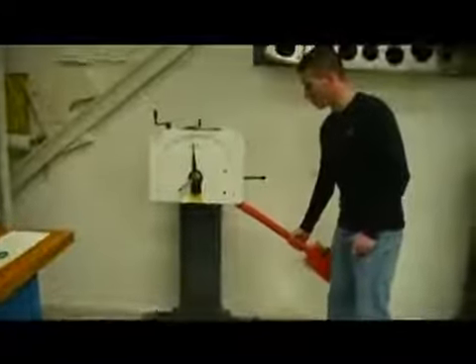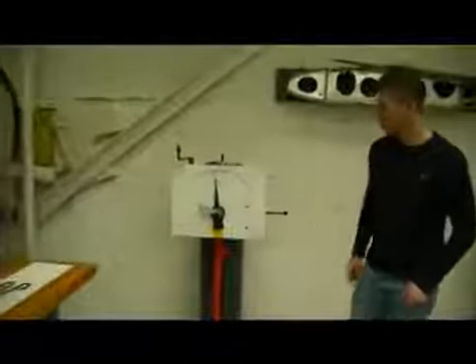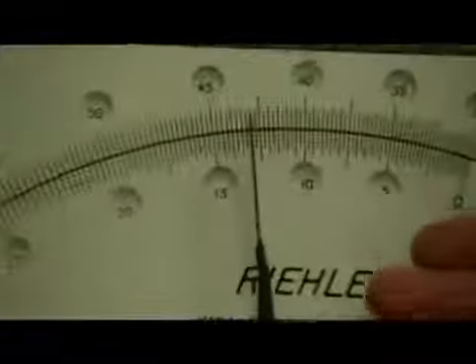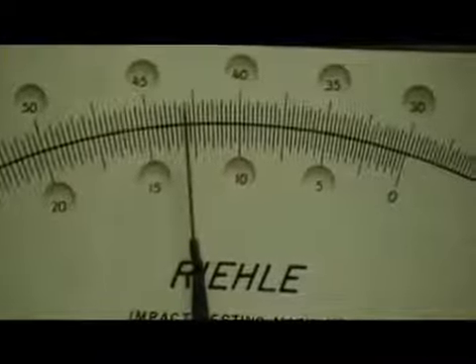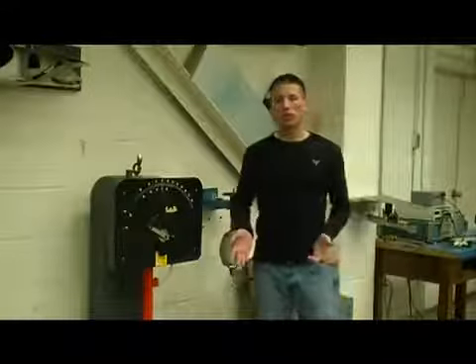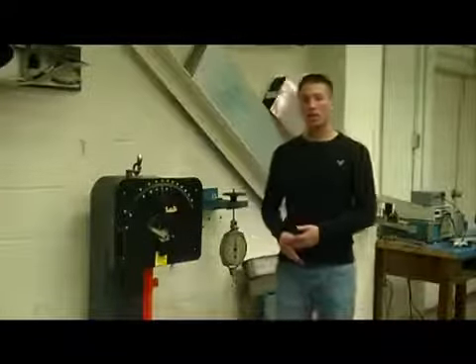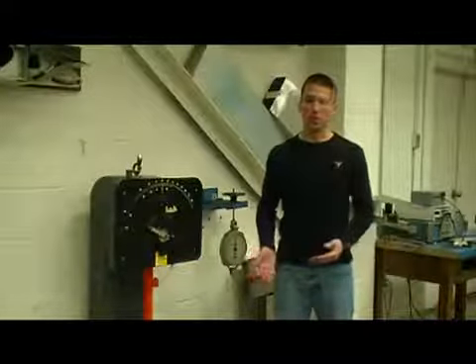Catching the hammer on the return swing and slowly bringing it down to its neutral position, we can go ahead and take our reading, seen here on the scale, from the 0 point that we measured earlier. Once you have completed testing a hot, cold, and room temperature sample of both aluminum and steel in the Charpy test machine, you can move on to the Izod test machine to test those same materials at those temperatures.